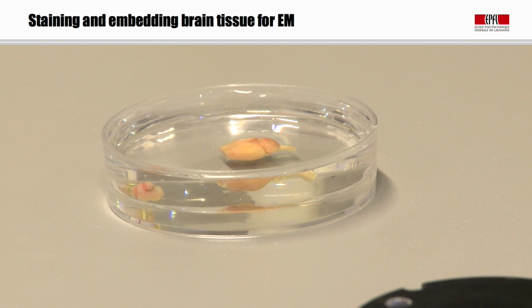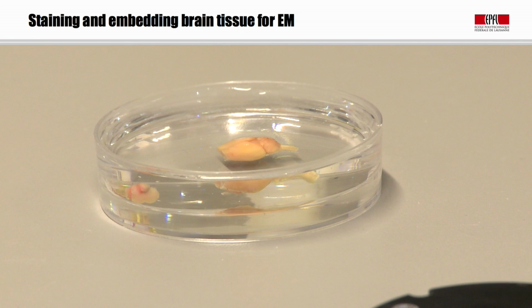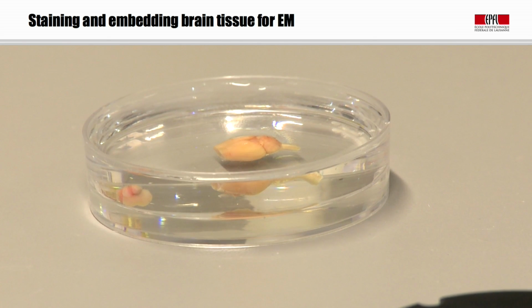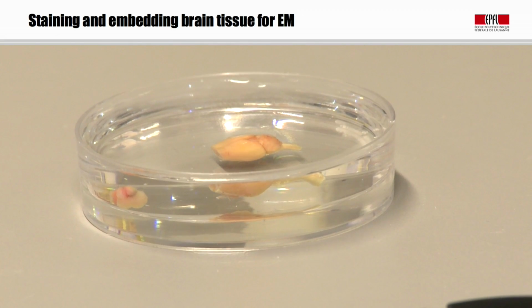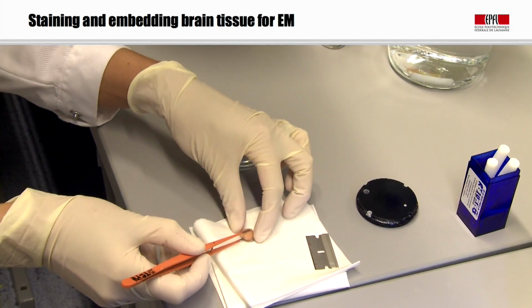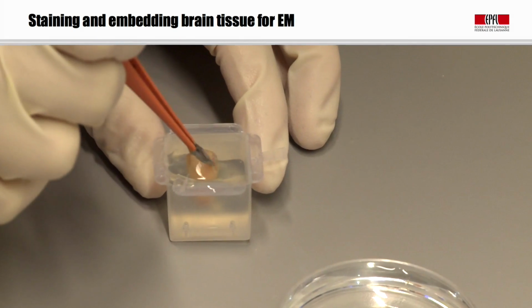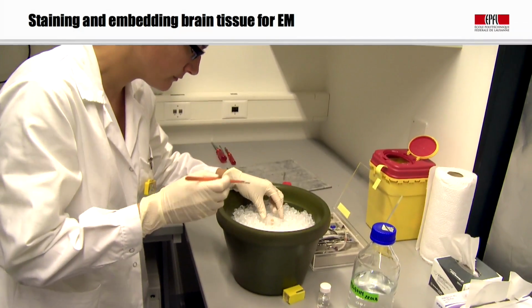So now I'd like to show you how we prepare a piece of brain tissue for looking with the electron microscope. And here we have a mouse brain that's been perfusion fixed with paraformaldehyde and glutaraldehyde. It's sitting in a Petri dish with PBS. So we take the brain and we just dry it a little bit, take off the excess buffer. We then push it into a small holder containing molten agarose.